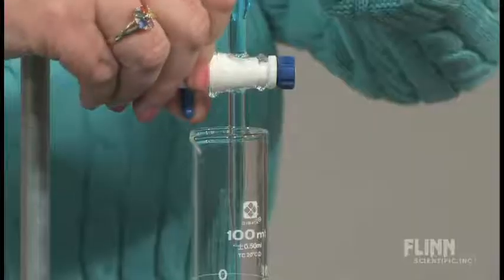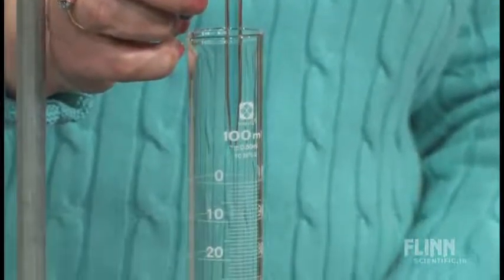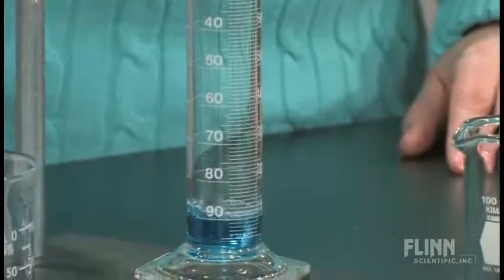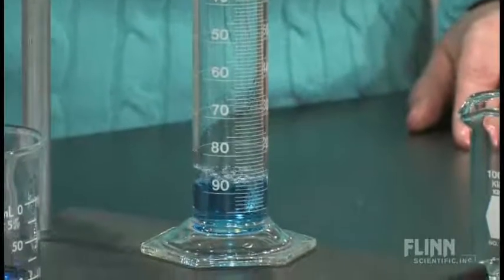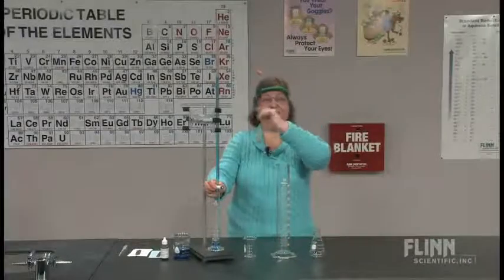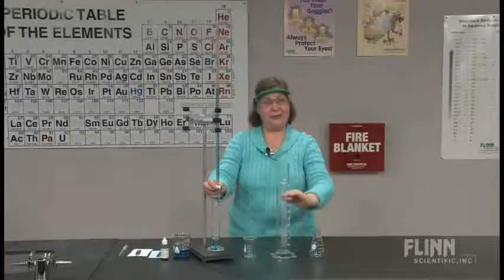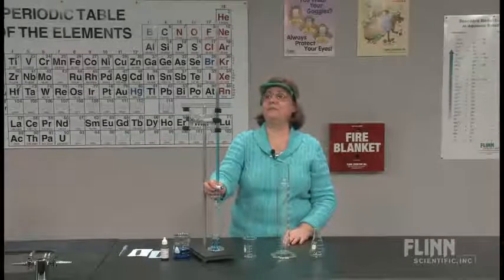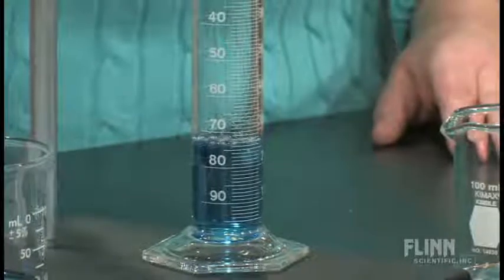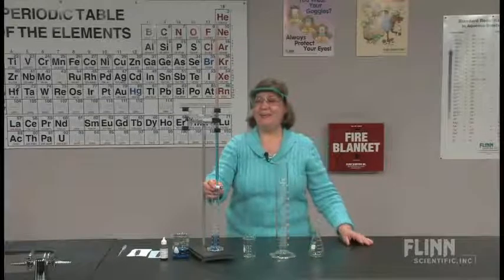And burettes are precise because they deliver the volume slowly, so that's going to go fairly slow, but we're going to try to get it at exactly 50. So obviously when I get down below here, I'm going to want to slow it down quite a bit. But we've got a way to go. One of the first things you have to teach students about burettes is the fact that you're reading from the top down, because it starts at 0 on the top and goes to 50 on the bottom, as opposed to in a graduated cylinder where it's going 0 to 50 or to the maximum volume. So we're just going to take 50 milliliters out of the burette. And that's going slowly, but you fill the time with a story.